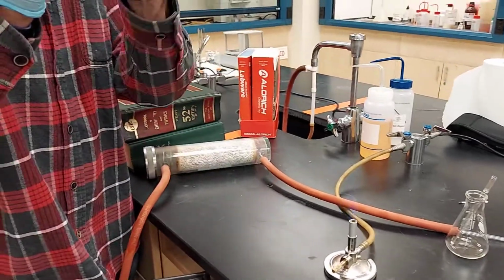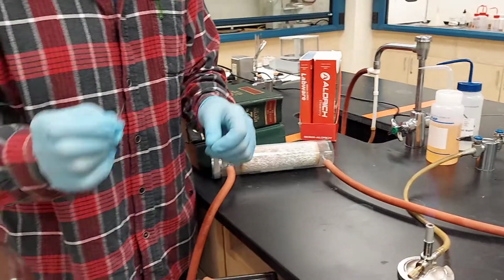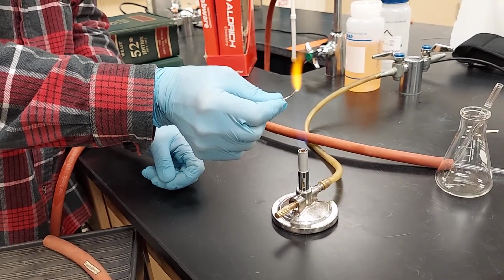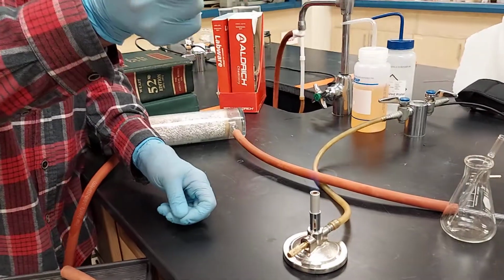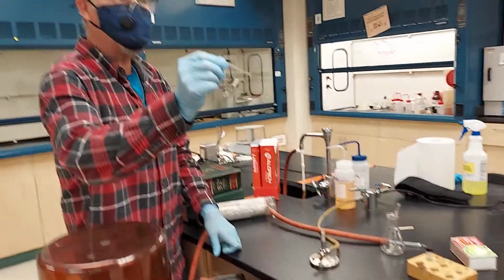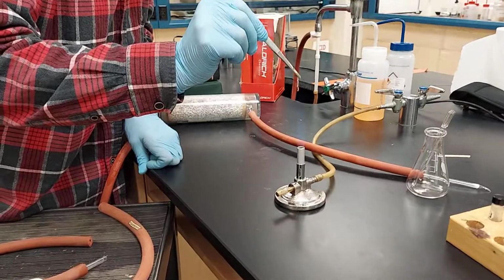And that was a little singe of my glove you saw there on the video. Pretty nice. And right now I've got to straighten this out, which might best be done using tweezers. Alright, I got some forceps, and I can try to straighten this situation out a little bit.